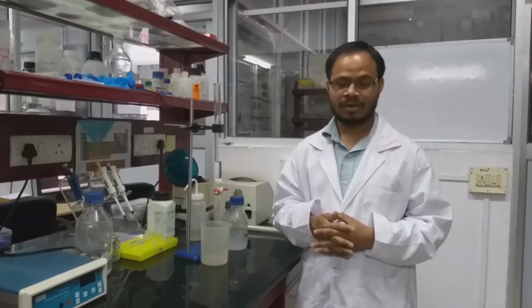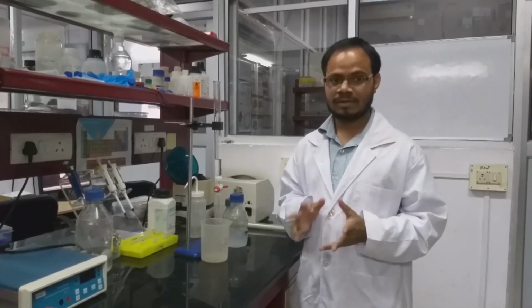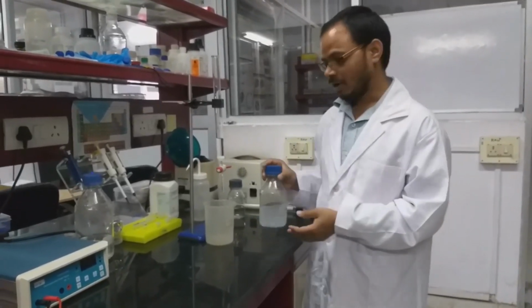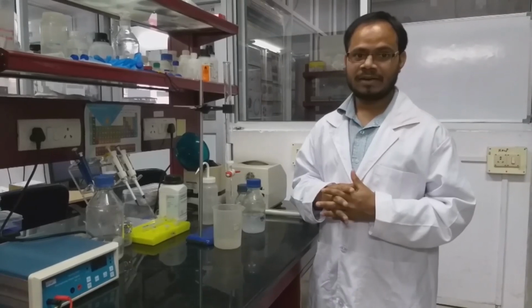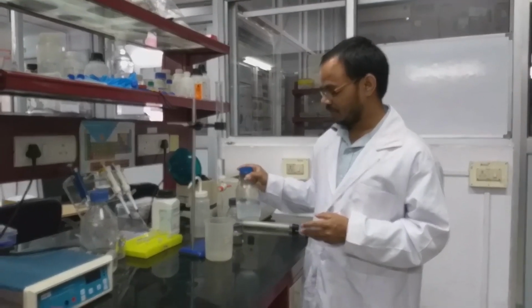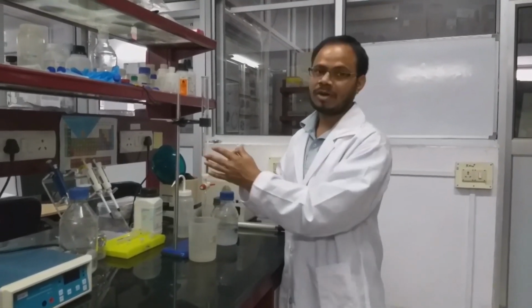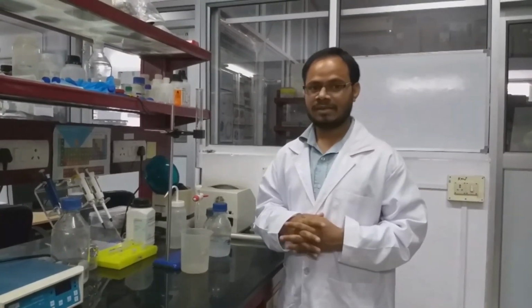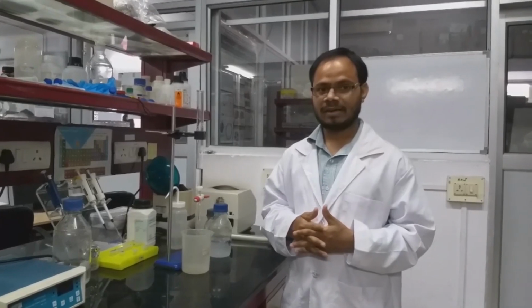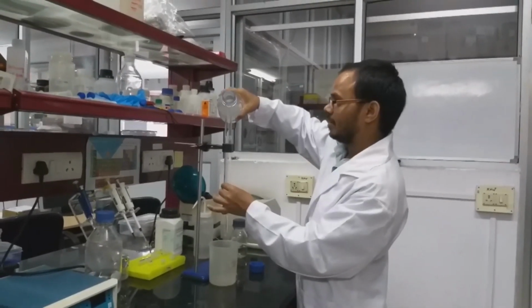There are different materials available: Sephacryl, Sephadex, Sepharose. These are all derivatives of carbohydrate material. Here, these are the overnight swollen beads. You have to take the dry beads and soak them in water or the buffer. So these are the swollen ones. Now, after inserting the sintered filter in the column, you have to wash the column properly, at least 2 to 3 column volumes with distilled water, so that any dust or other contaminating particles are removed. Now we directly pour the beads on top of the column.